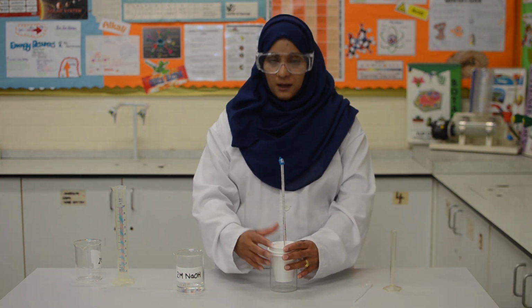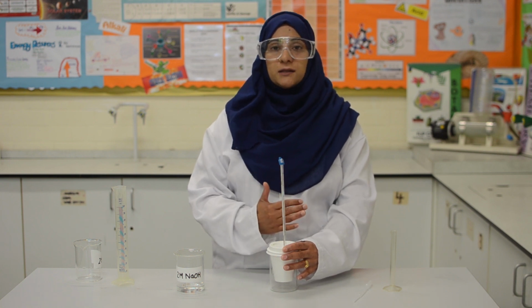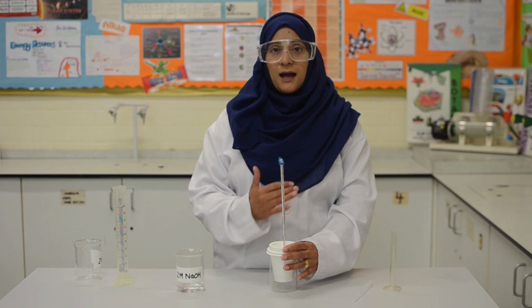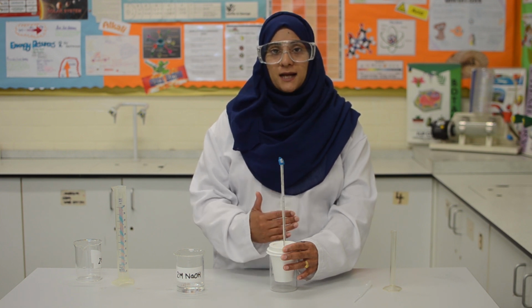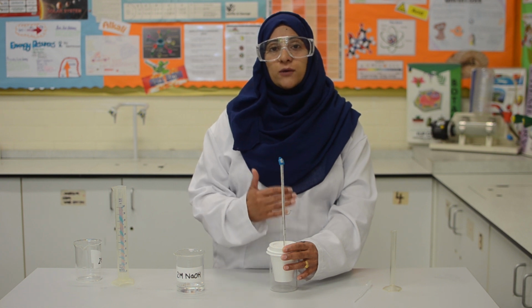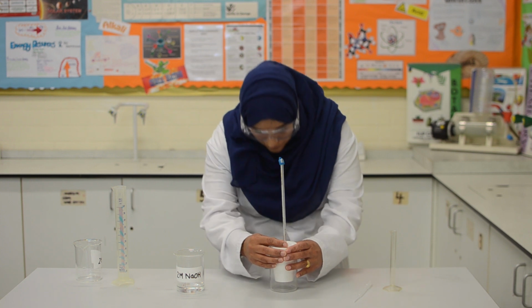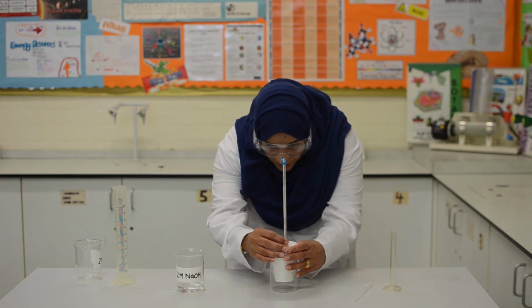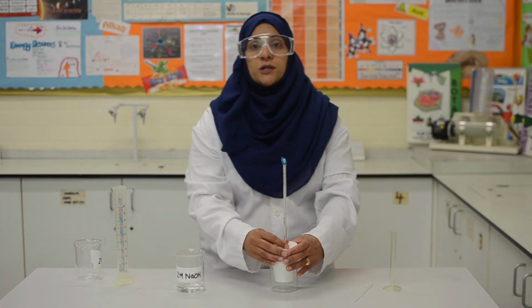Now, I will take the reading on the thermometer and record this reading as the initial temperature of the hydrochloric acid on 0 amounts of sodium hydroxide added. And I read that at 22 degrees Celsius.